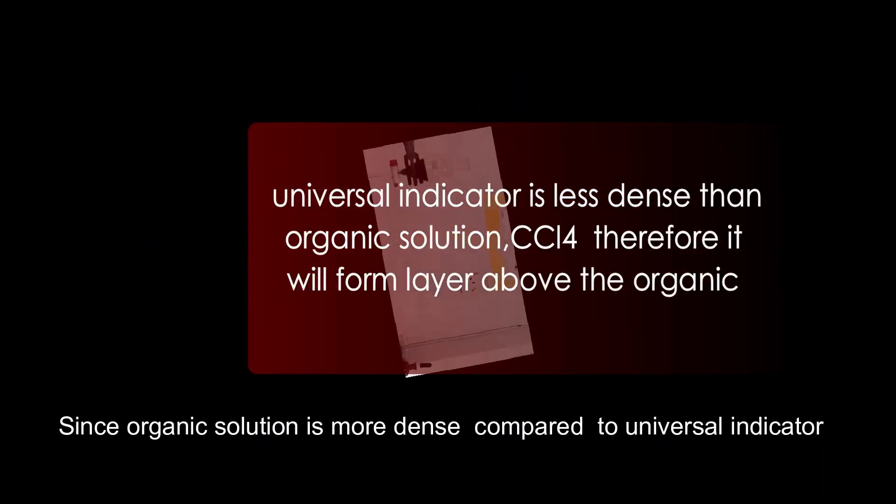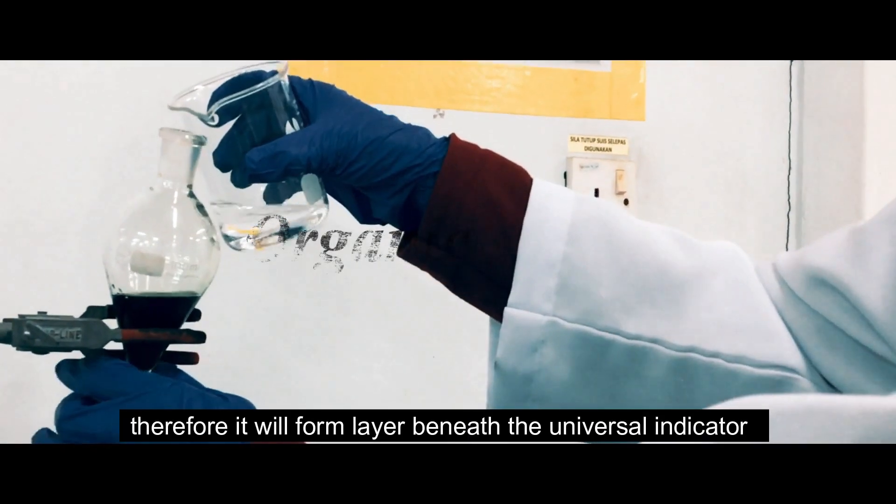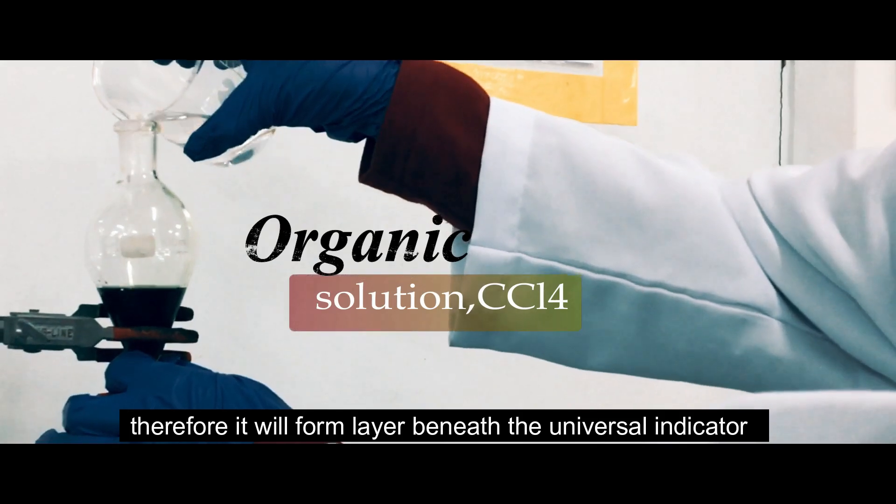Since organic solution is more dense compared to universal indicator, it will form a layer beneath the universal indicator.